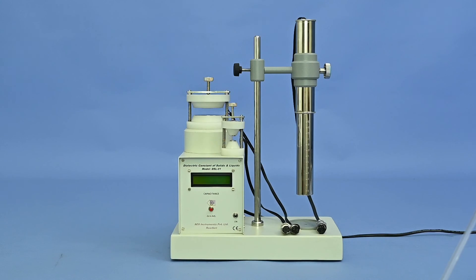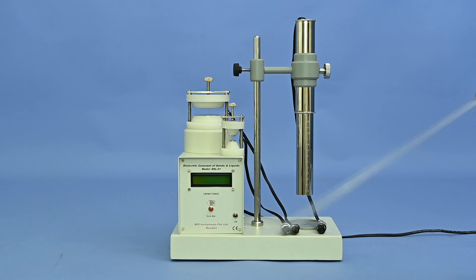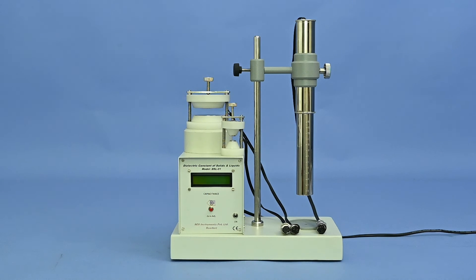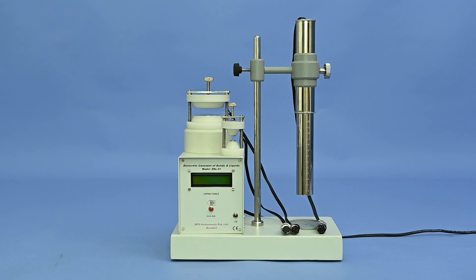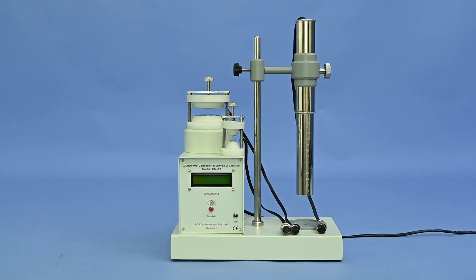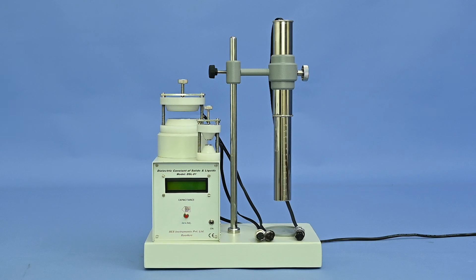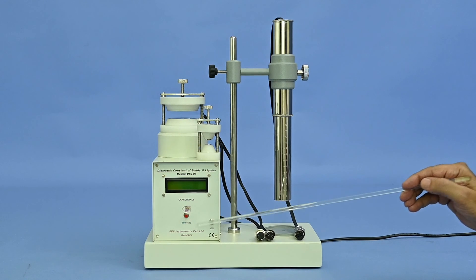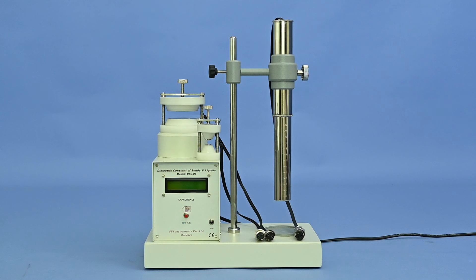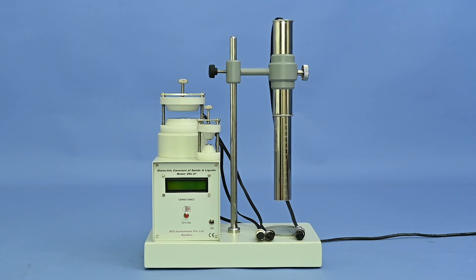The DSL01 consists of various parts. First, the Digital Capacitance Meter — a compact microcontroller-based capacitance meter. Its range measures from 0 pF to 50 uF with auto-range facility. A push button is used for zero setting, and the accuracy of reading is better than 1% with 0.1 pF resolution.